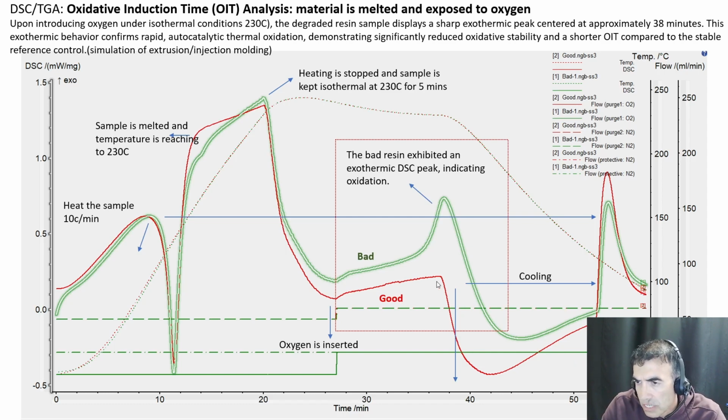You can see that for good resin, this works very well, and the oxidation is controlled. For bad resin, however, you can see at about 37 minutes a peak. That region is called the oxidation induction time, and it means that after some time the bad resin, or bad compound, gave up to the oxidation reaction. We see an exothermic peak because the oxidation reaction is exothermic, and that peak shows that the bad compound doesn't have enough thermal stabilizer inside. That's why it's more prone to oxidation.